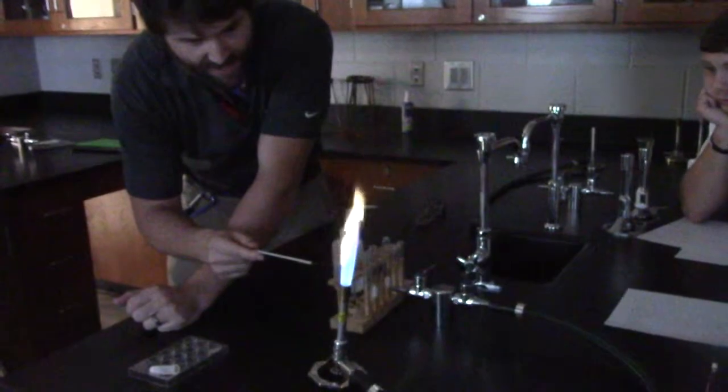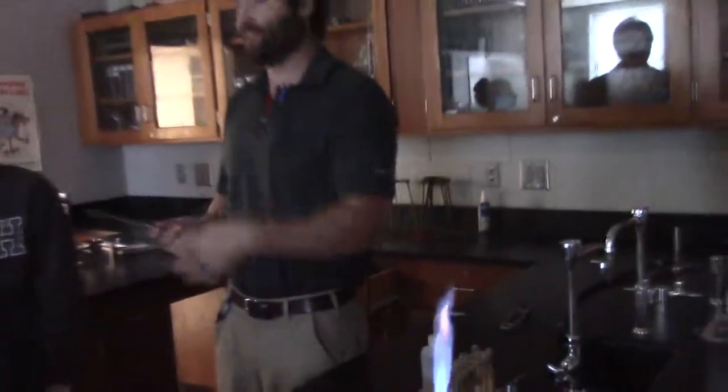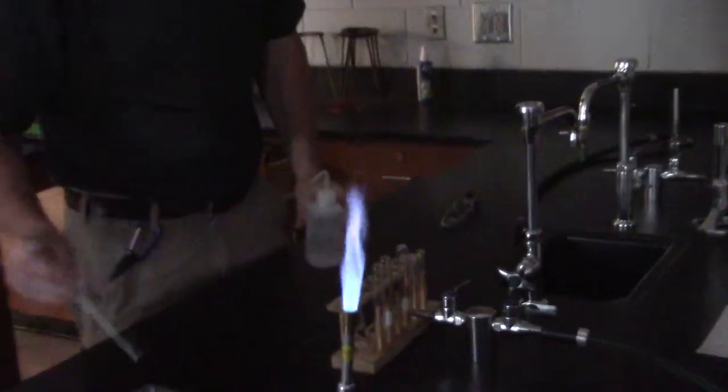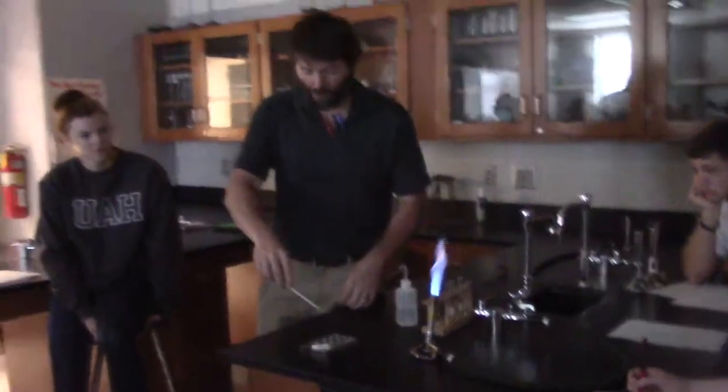And you can start seeing that color that it gives off. And then all I'm going to do is go to my data table and write down what color. Do it again, do it again. Fine. Yes. If you want to repeat, moisten it one more time. Moisten it, it's an odd word. Moisten it, stick it back in, and as long as I'm doing the same chemical, I ain't got to clean it. Alright, but take a wild guess. When I'm done with that one, before I move to the next chemical, guess what I need to do again?